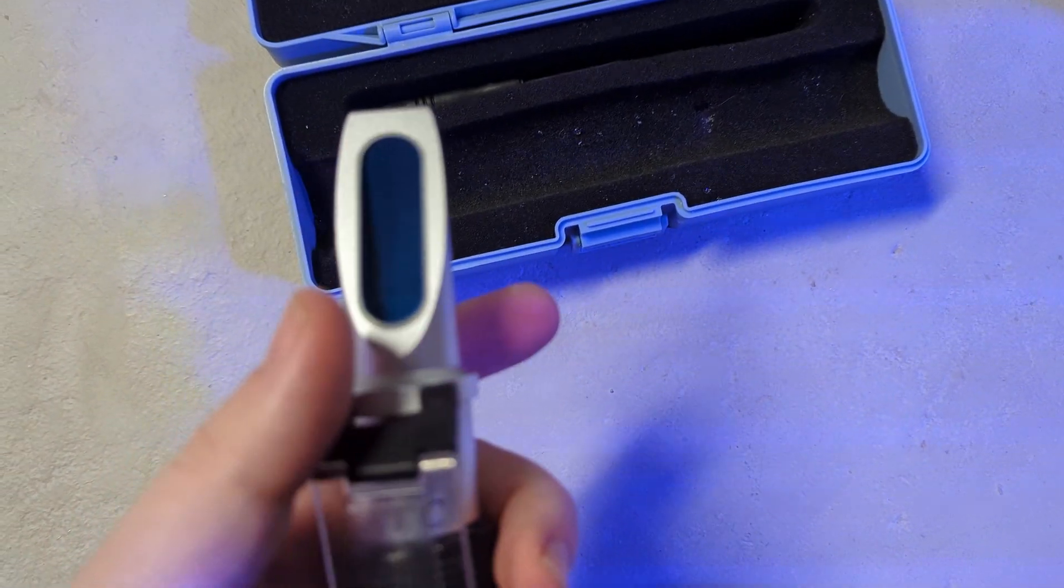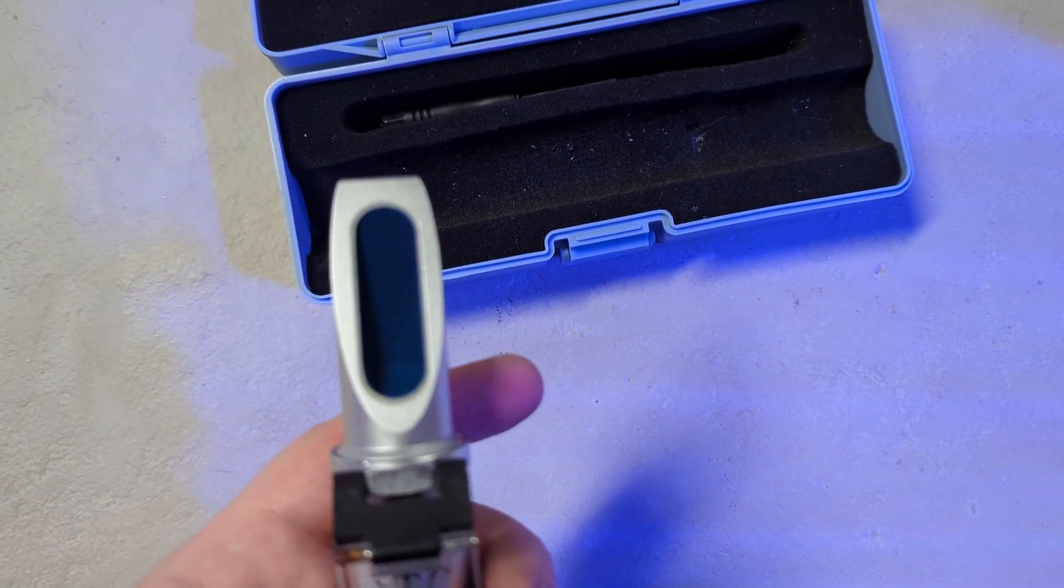Hopefully this video gives you a quick rundown on how to use the refractometer. It's a great tool to have and probably my go-to saltwater testing tool. It's great for water changes, quick and easy to use, and I highly recommend it for most instances. Let me know if you like this video and if you stop and buy.